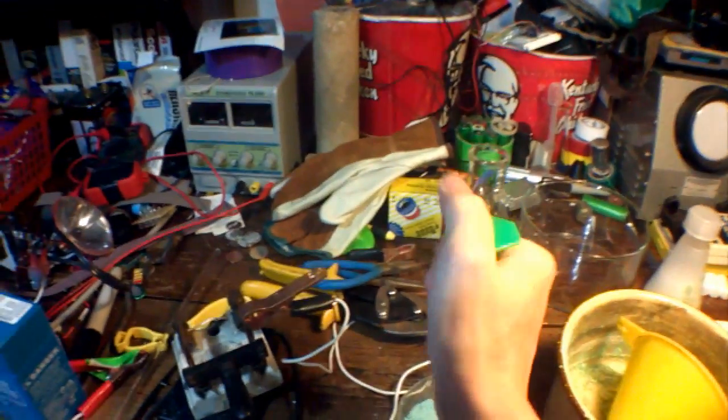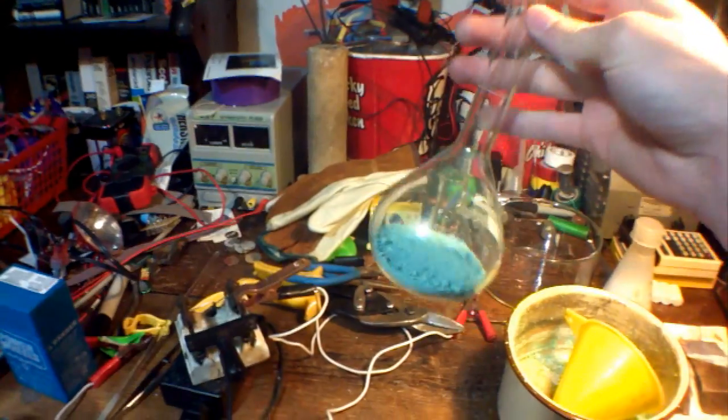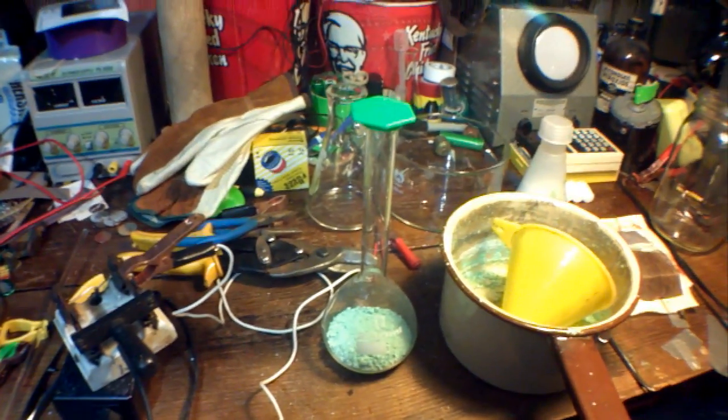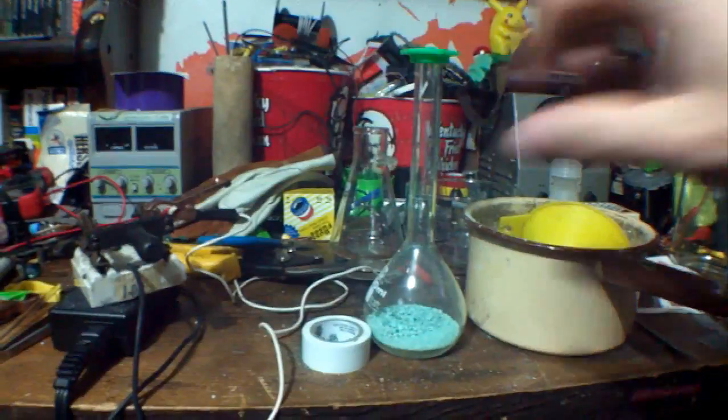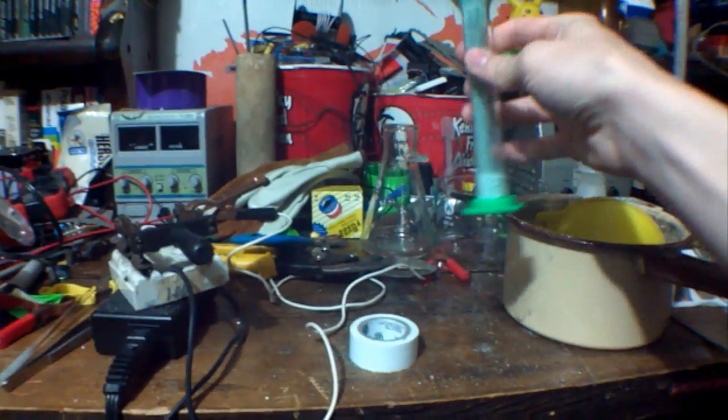But there you go. I don't know of any uses for copper hydroxide. I was originally aiming to make copper sulfate so I could electroplate things with copper, but I wound up with that. Anyways, I might have found a use for it—well, not really a use, but a way to play with it.